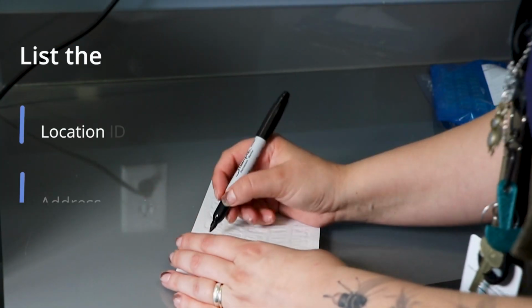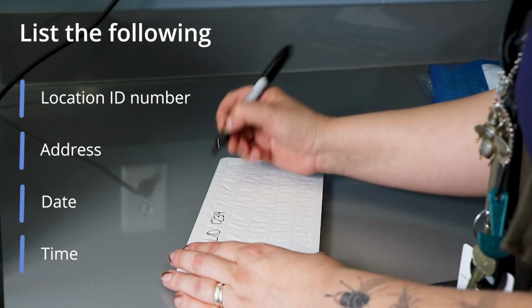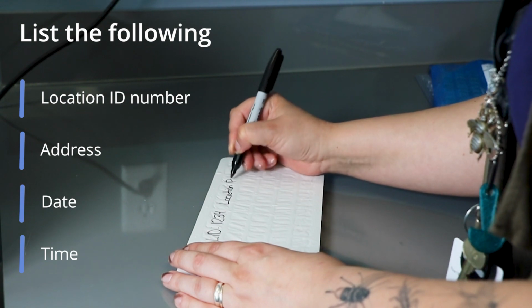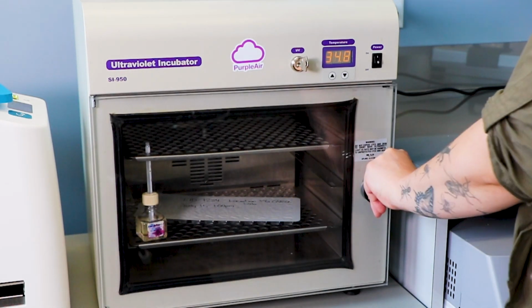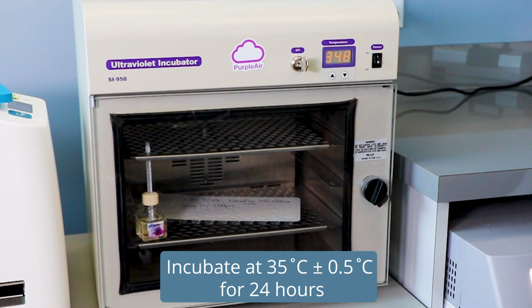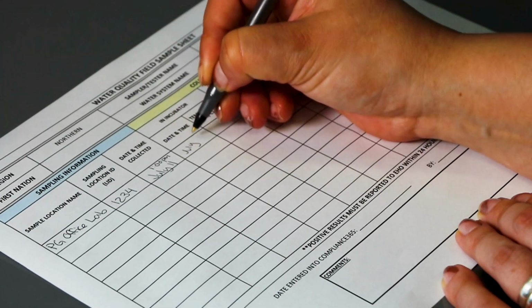Write the location ID, address, date, and time on the back side of your tray using a permanent or soft tip marker. Don't use ballpoint pens as they can break the seal of the tray. Place your tray into the incubator. Incubate at 35 degrees Celsius, plus or minus 0.5 degrees, for 24 hours. Record the incubator temperature on your field data log sheet.